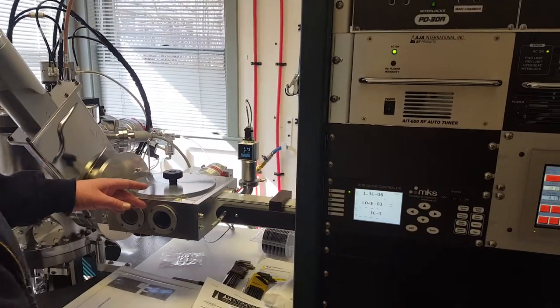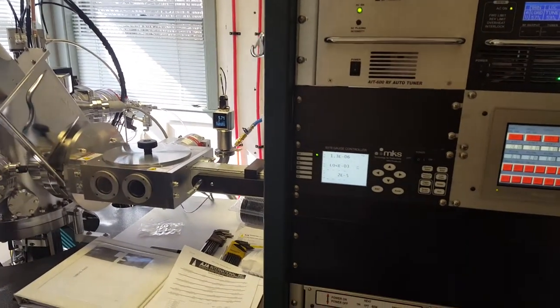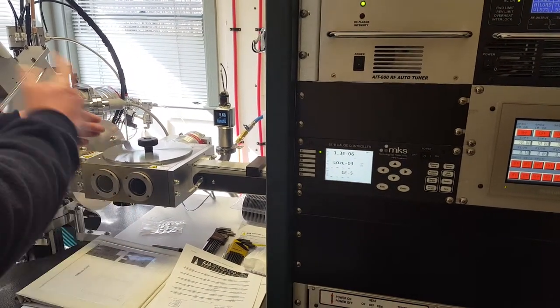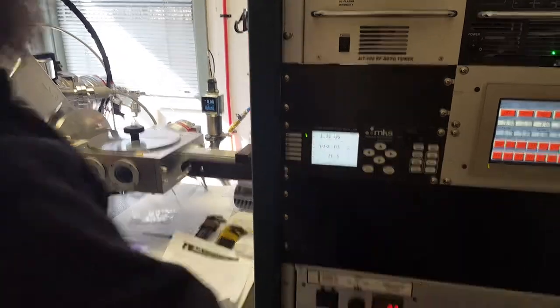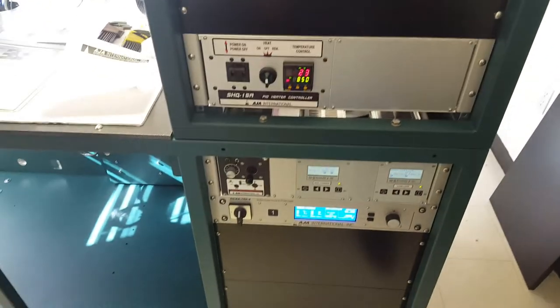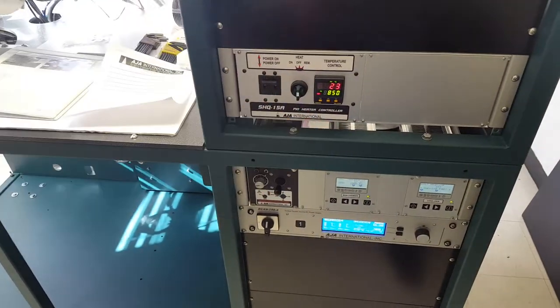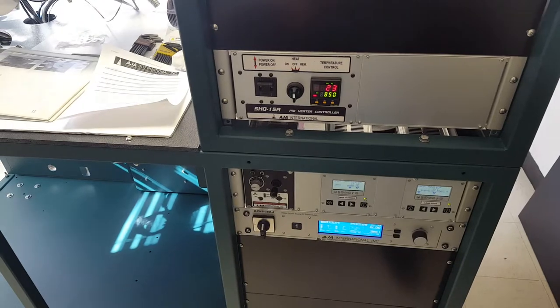The turbo is still spinning, and the spinning turbo actually powers the controller. So this is receiving its power from the turbo.